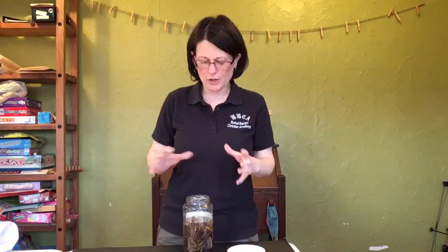Haley also wanted to know about the pollutant. You have two jars — one stays like the control, and in the other you add a pollutant. The pollutants listed in the materials that would be good choices are things like baking soda or vinegar, which change the pH and could affect what will live in there. Add about a tablespoon of baking soda or a tablespoon of vinegar. The lab is kind of vague on amounts because it doesn't know what size jar you're using, so just try it out and add more if it doesn't seem like enough.